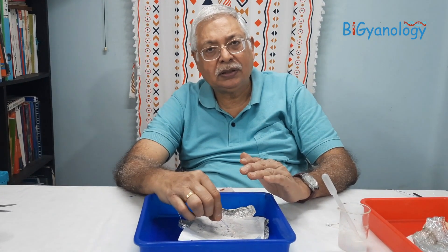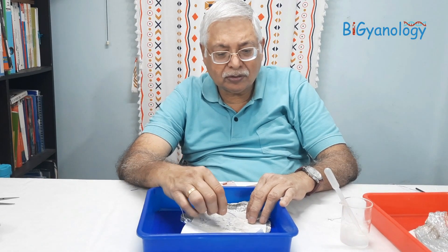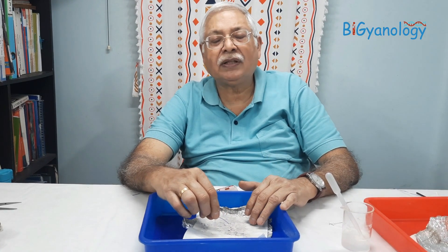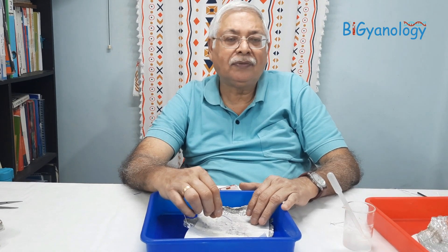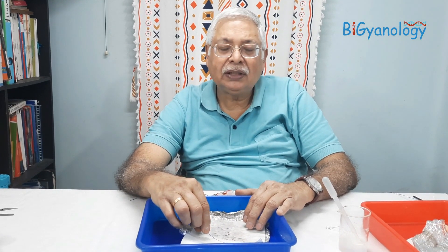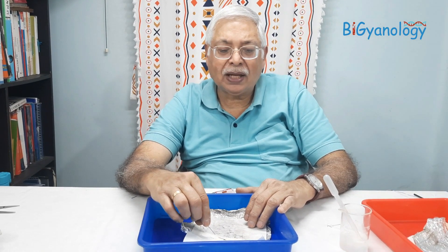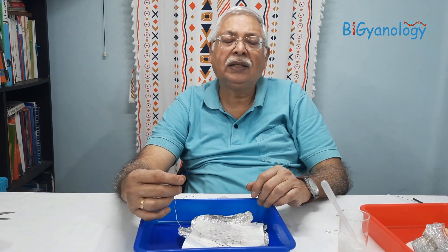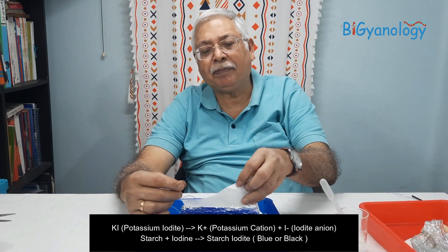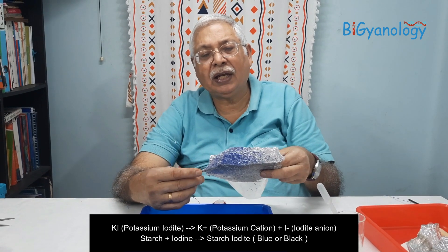When the positive-charge wire comes in contact with the potassium iodide solution, it dissociates — the iodide ion goes to the anode and immediately becomes iodine (I₂). This iodine then reacts with the starch. Previously there was no reaction because the iodine was bound to potassium. The moment we touch the wet paper, the iodine dissociates and forms the starch-iodide complex, giving a conspicuous blue-black color. This is a very interesting way of showing electrolysis and the ionization of potassium iodide in wet paper.